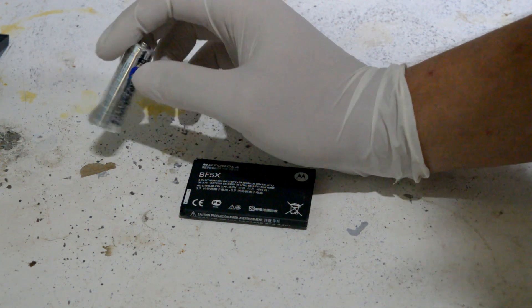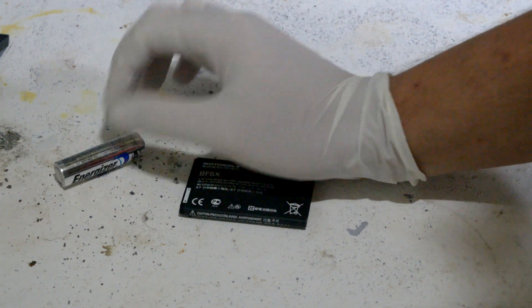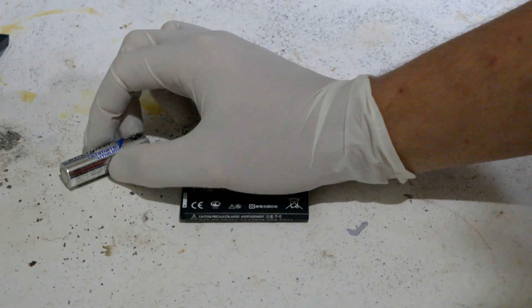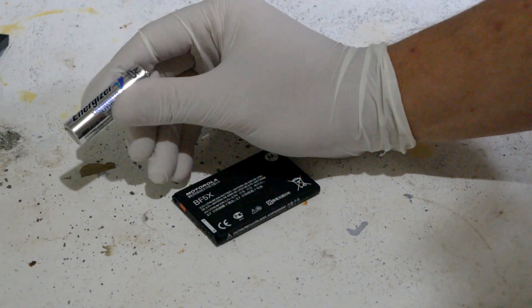It's not a very difficult extraction. All we have to do is break the steel casing and then pull it out. You can do it nicely with finesse, but I just get some bolt cutters, cut it, pull it out, chuck it in oil. So that works.